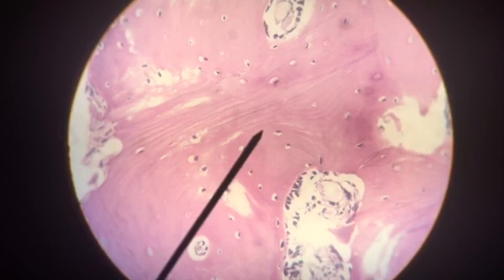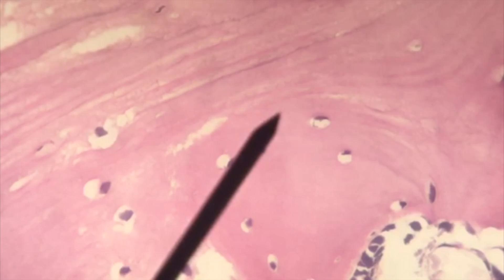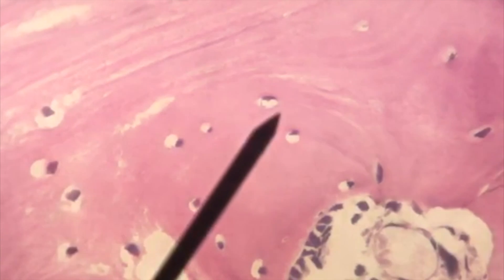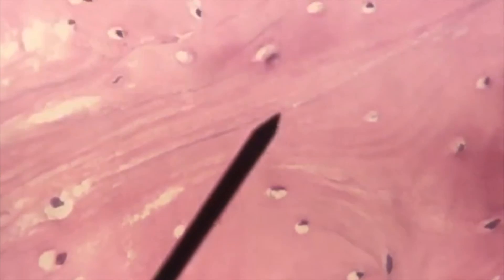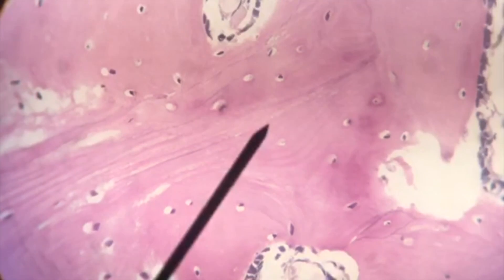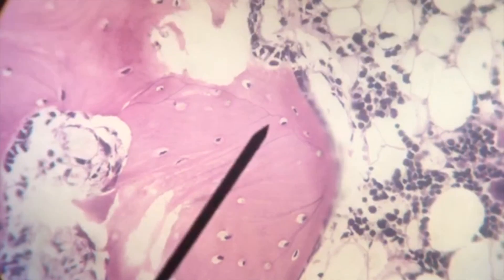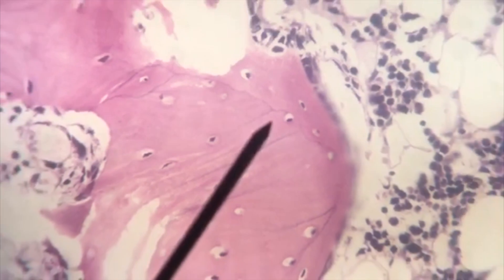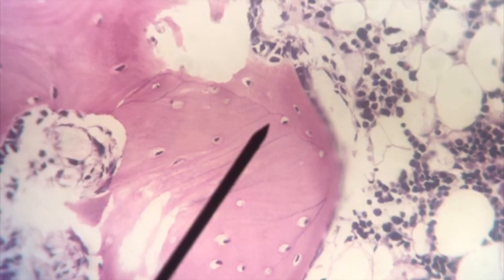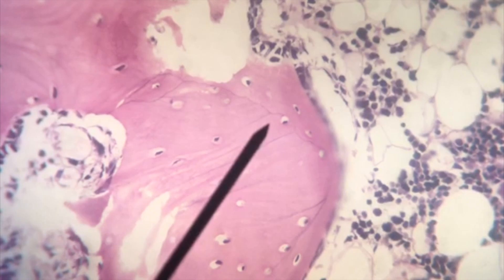The second cartilage we're going to look at is called fibrocartilage. Again, as we zoom in, the lacunae with the chondrocytes located within them are the same. The key is in the matrix — it is wavy and pink. These are large amounts of collagen fibers running through the matrix in between the lacunae. Fibrocartilage comprises the intervertebral discs in humans, and we also find it in the pubic symphysis — that little fibrocartilaginous pad between our pubic bones. This is functionally important because it allows us to withstand a tremendous amount of stress.